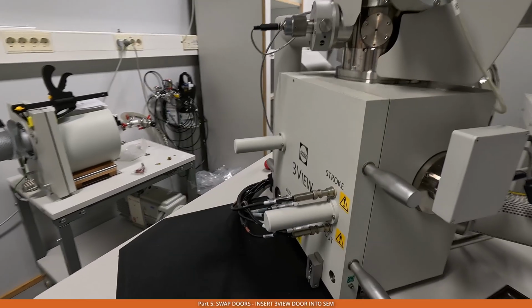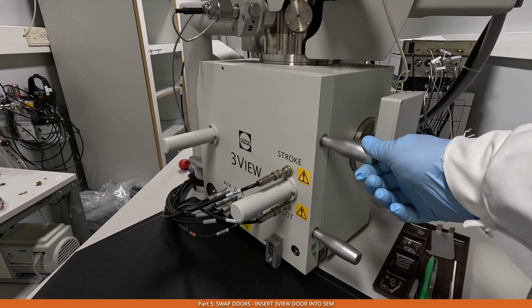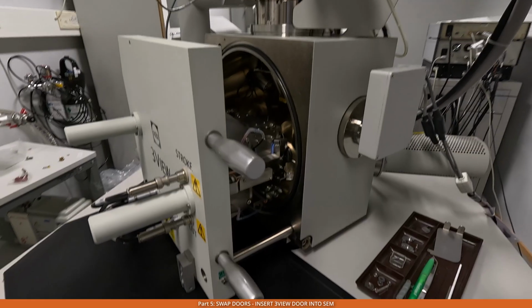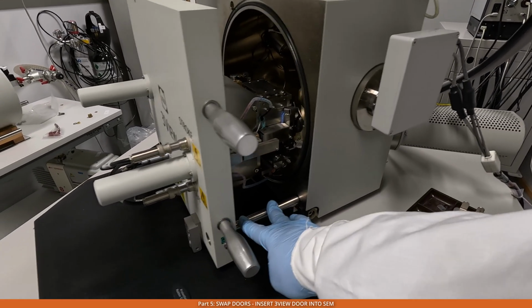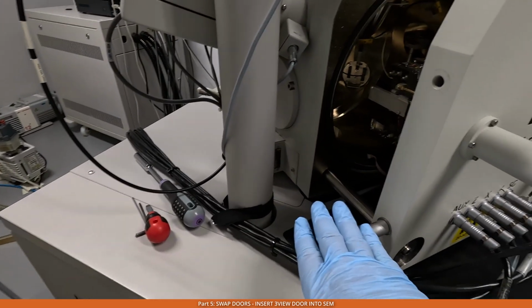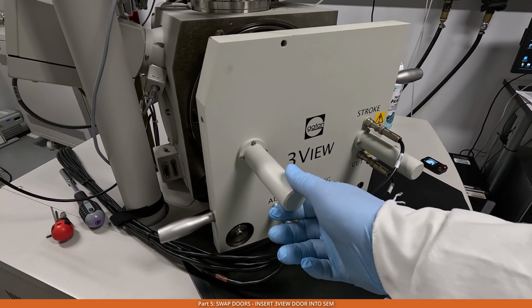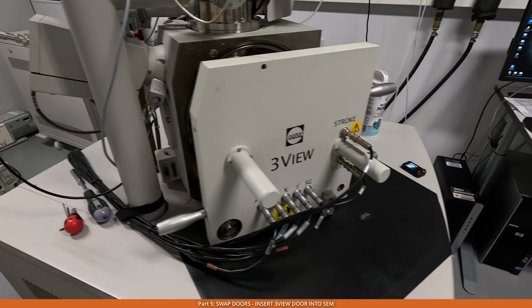When you are changing the doors, make sure that you take the door using these handles on the sides, like this one, and the rail here, this one. So you can use these handles and the rail from this side and the same from the other side. So handle and the rail. Do not touch these ones or use these ones for holding the door, because these are for the motors. You can break them quite easily.